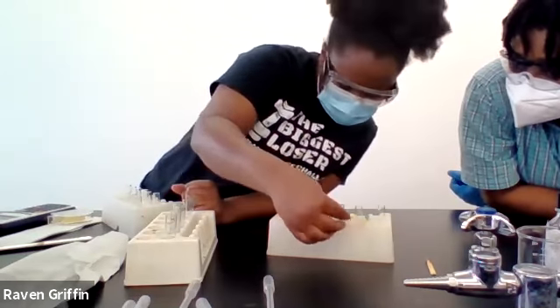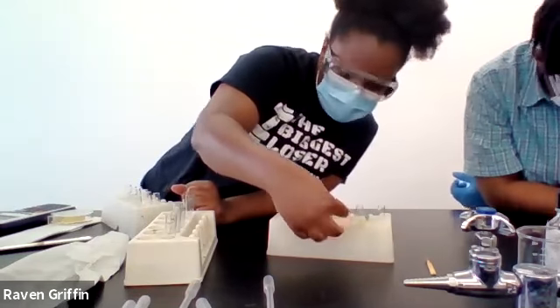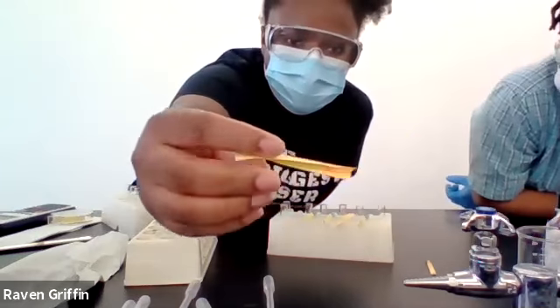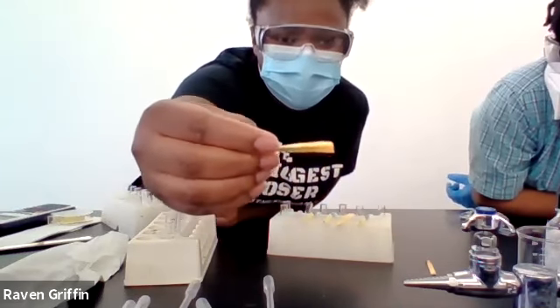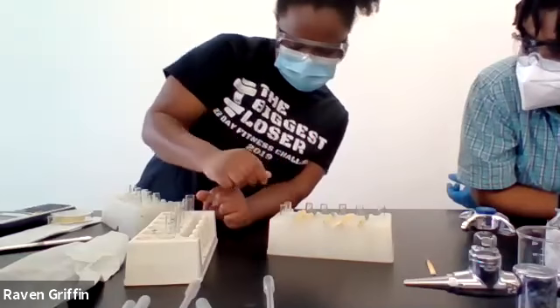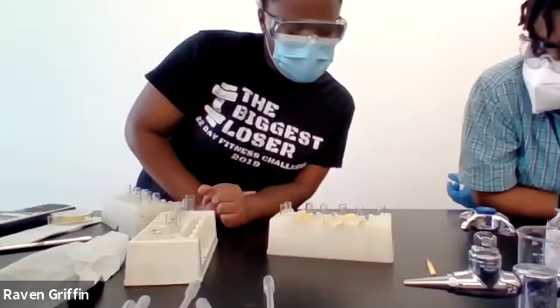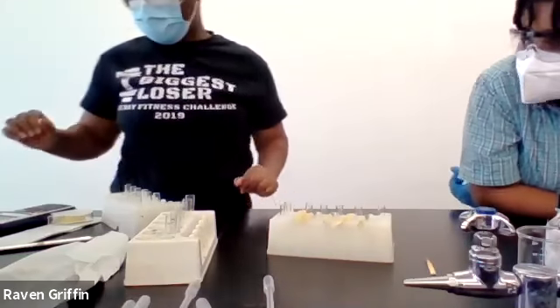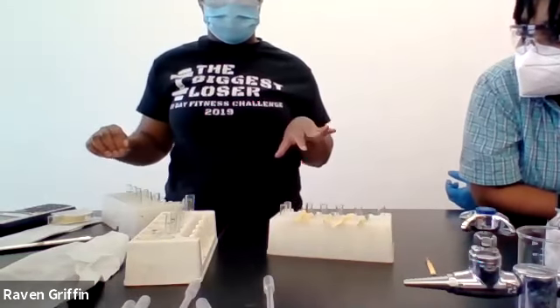Which one is missing? Okay, and that's like a darkish orange color. Which one was that dark orange? NaH2PO4. Okay, thank you. And so that was for part C.